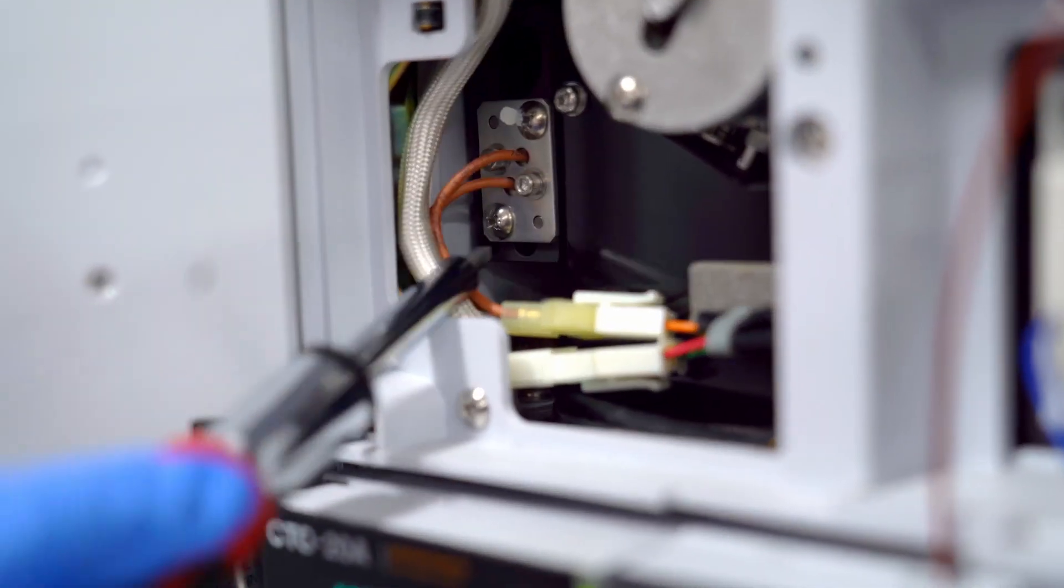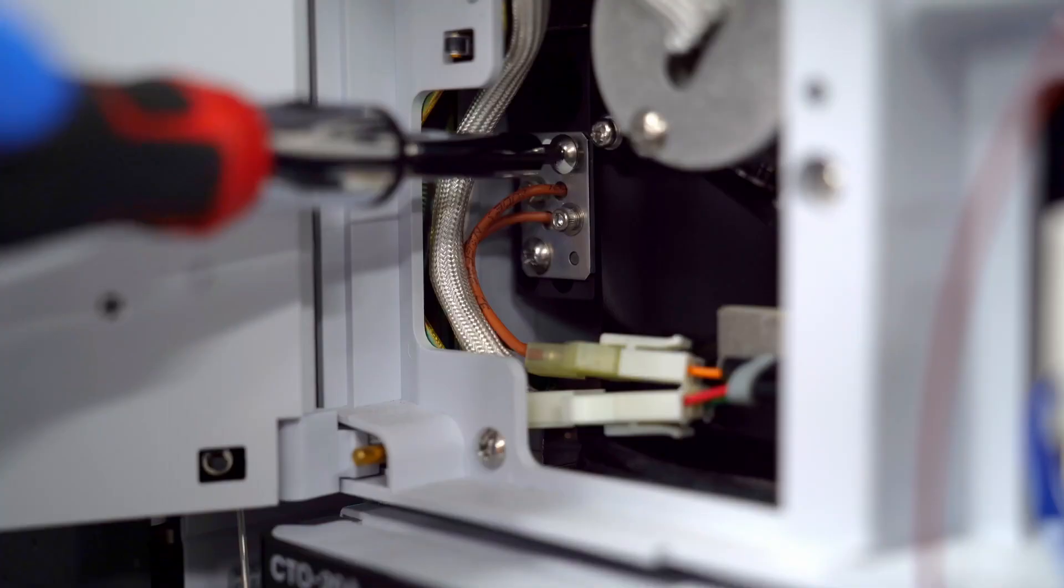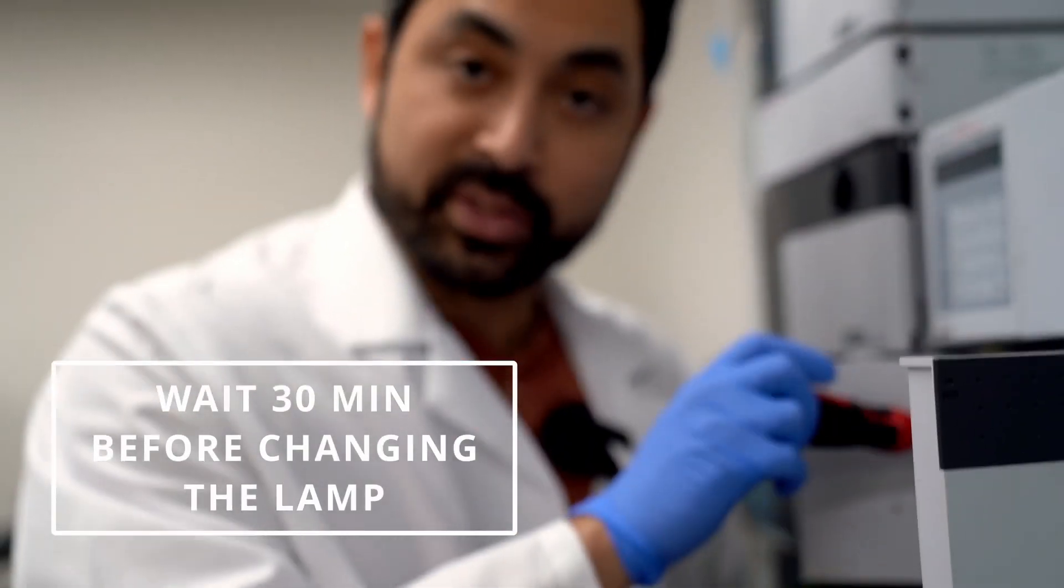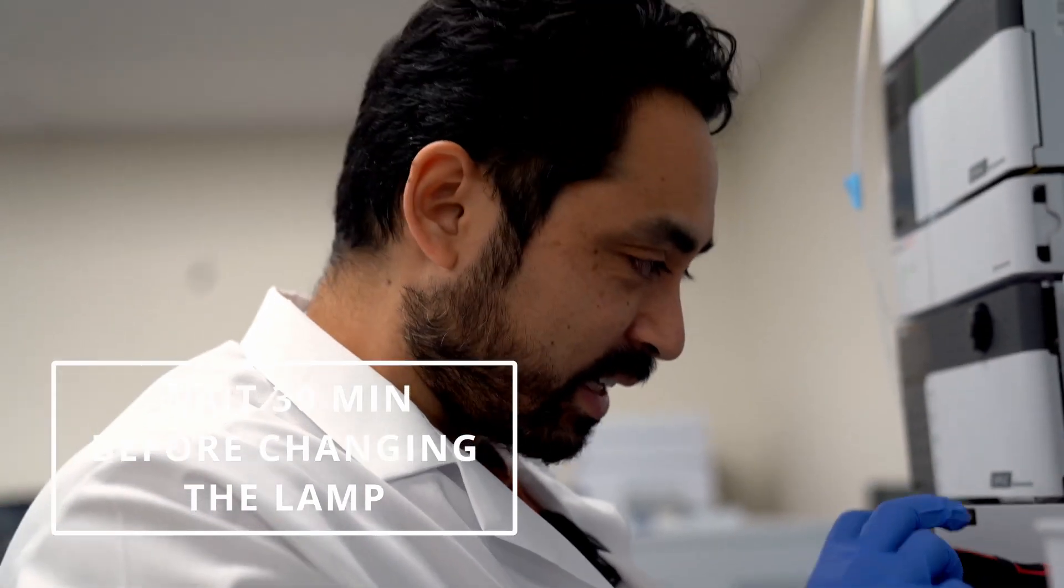You want to take off this screw here and this screw there. So let's do that. By the way, make sure you wait 30 minutes for the lamps to cool, otherwise it's going to be really hot.